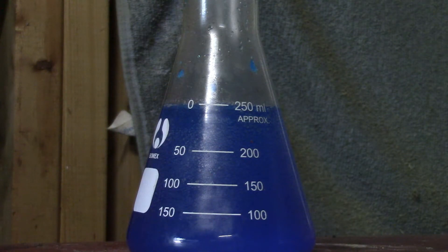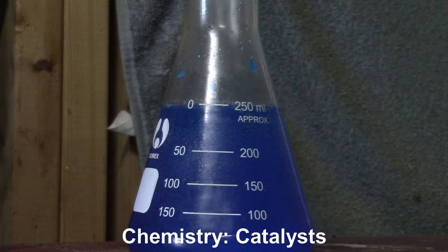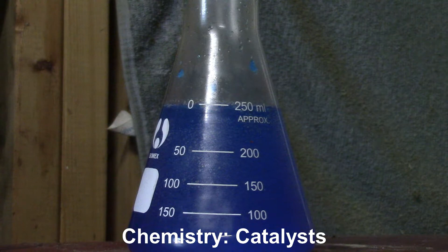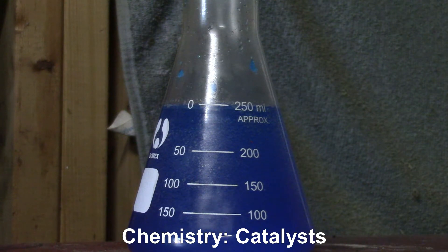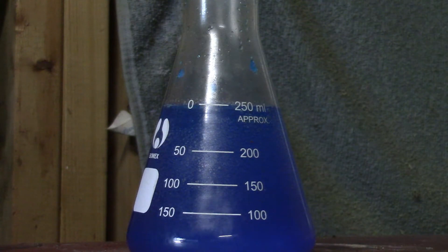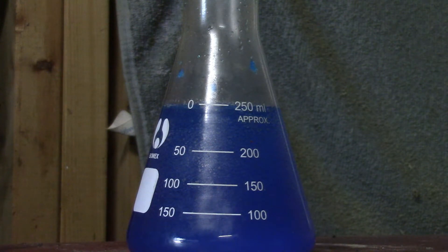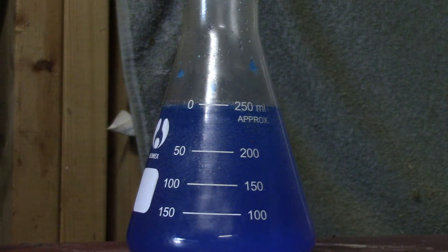In this video we're going to look at what a catalyst is and what it does in terms of a chemical reaction. I have a 250 milliliter Erlenmeyer flask filled with 200 milliliters of water and 50 milliliters of copper sulfate granules, giving a 250 milliliter concentrated solution of copper sulfate.